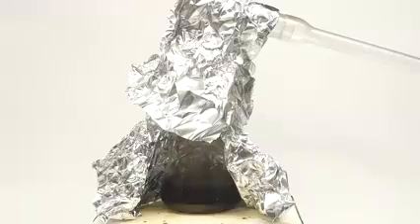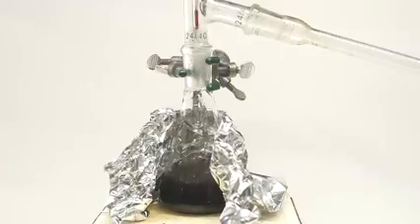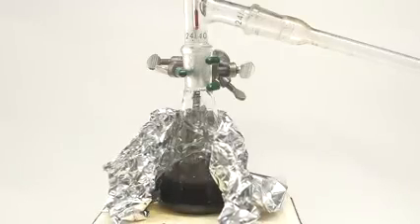If I actually did make triglycerides in this reaction, the major one should be triolein. However, the boiling point of triolein, even under my full vacuum, is still above 400 C. There are very few thermometers that will go this high, and the one I have only goes up to 250 C. So because of this, I have to go without a thermometer, and it makes things a little bit more difficult. Instead of identifying different fractions based on temperature, I have to do it by appearance, which isn't going to be super precise.